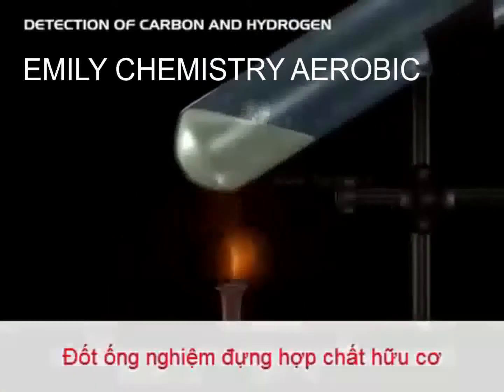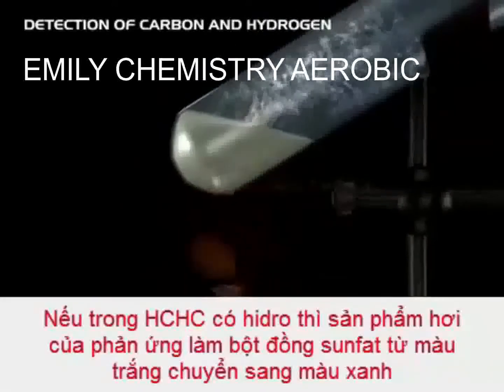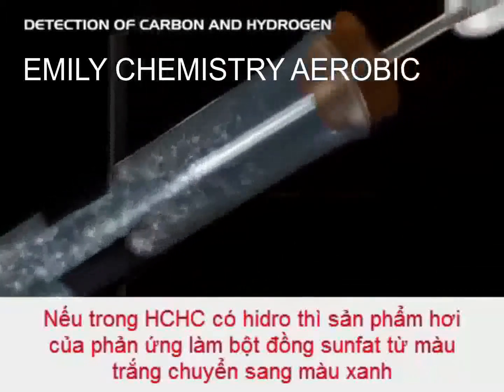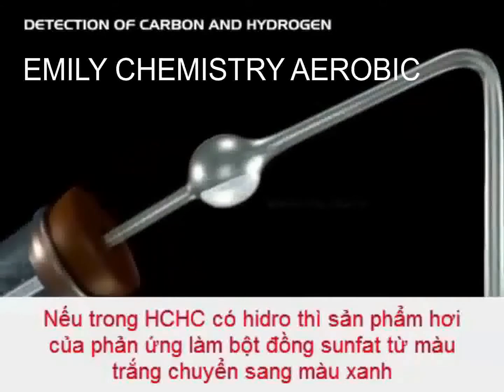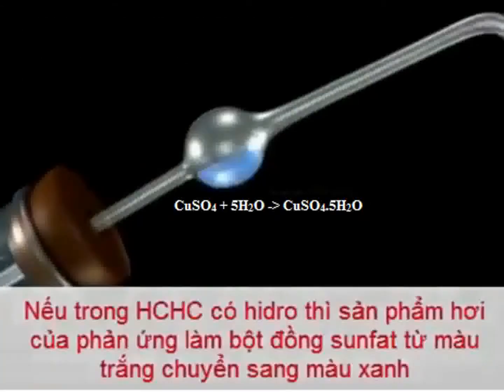The evolved gases are passed through a delivery tube containing a bulb with anhydrous copper sulfate. Then, it is passed into lime water taken in a test tube.